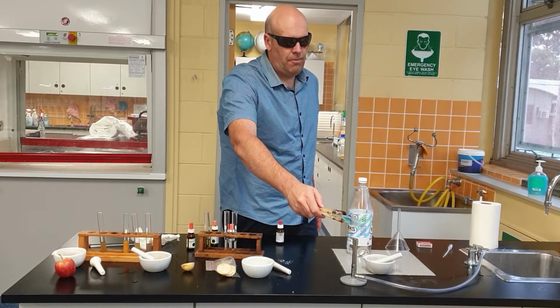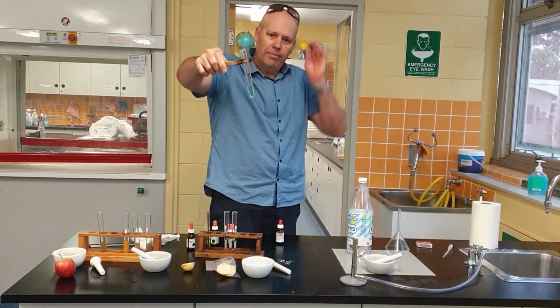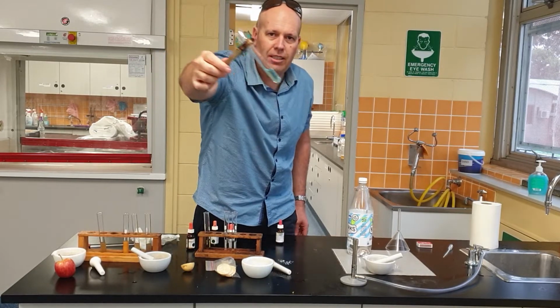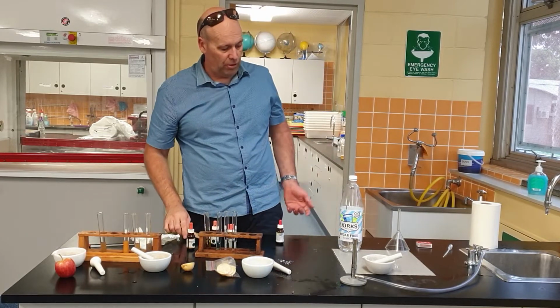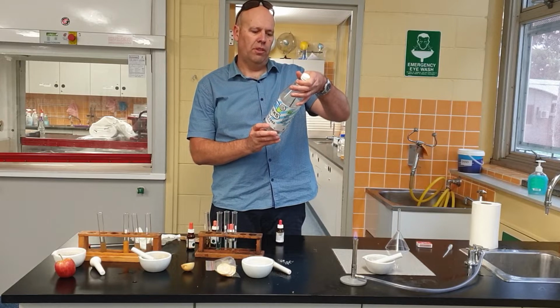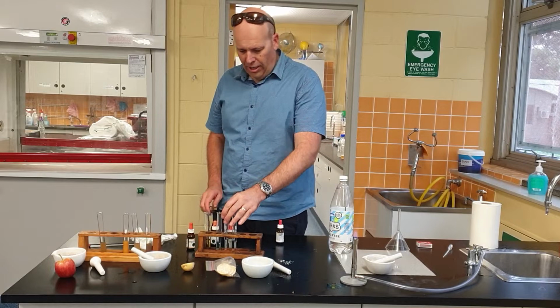The claim, whoa! Okay, the claim, I think we can verify that, yeah, there's no sugar in it. It's sugar-free, well, it's free of glucose anyway. It might have sucrose. Let's have a look at this. No, it says no sugars. 0, 0, 0. So they're not lying. It's sugar-free.